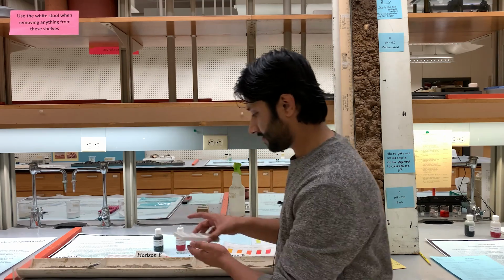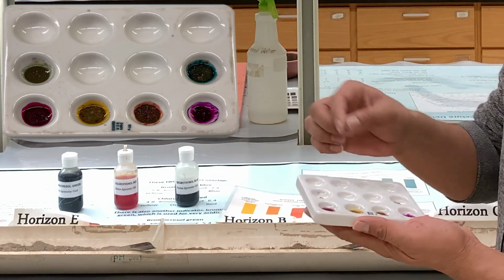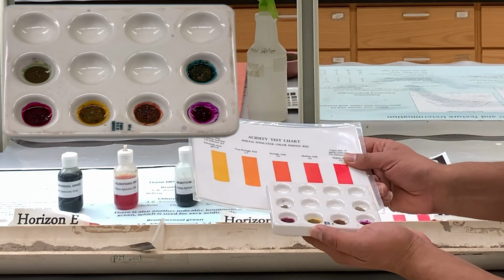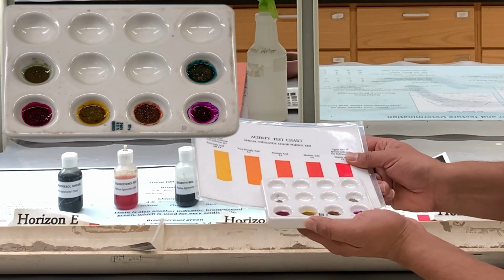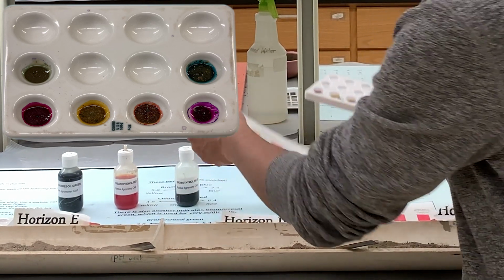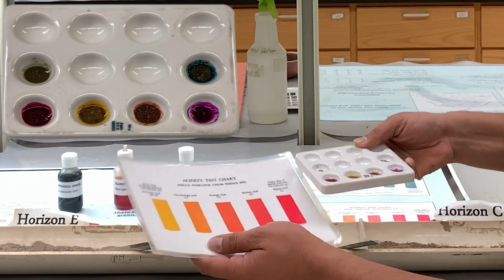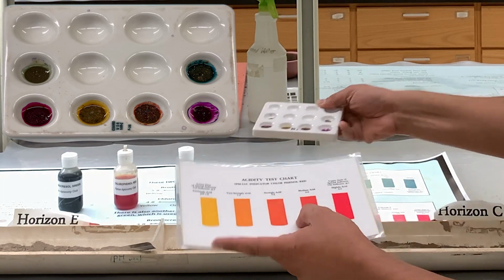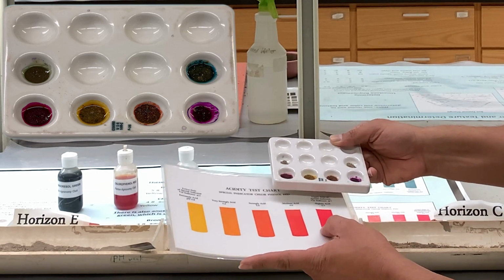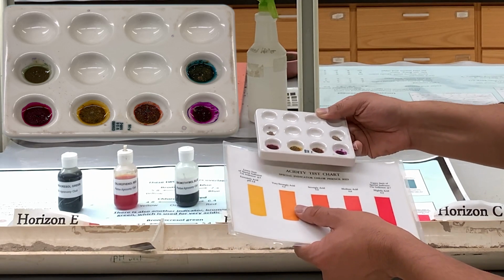What I already did, just for the sake of time, is add these red dyes to these 4 horizons, and you can see that there are charts that you can compare these with the reading. So what we have right now is that the first horizon is out of the range of this chart, so we will need to use a different indicator. This is 6.4 pH, so this is higher than 6.4, therefore we will use the blue indicator for that one. And similarly for the C, we're out of the chart, so we will also use a blue indicator for that one. But for these 2 middle ones, we can use the readings based on this chart.